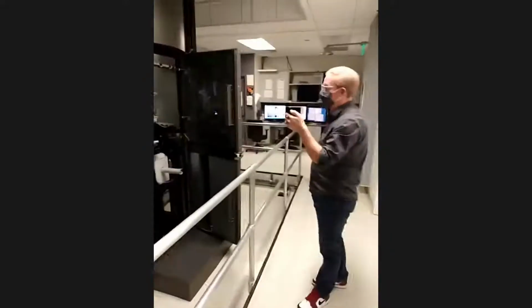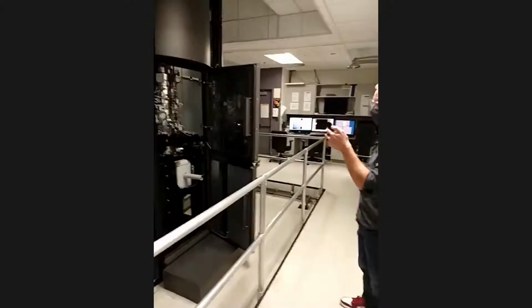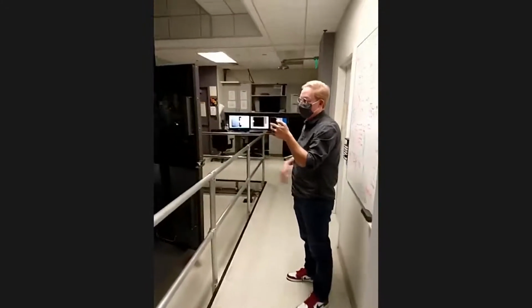And when Peng says camera, this is not your traditional camera. So this camera can directly collect single electrons, right, which is a very, very fancy camera that allows us to push the sensitivity of the microscope and allows us to go at very, very high speeds to achieve these really high levels of resolution.